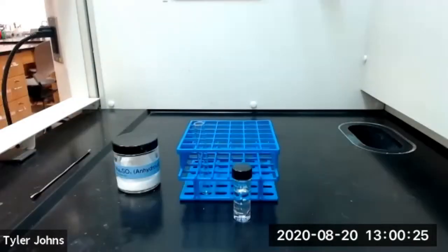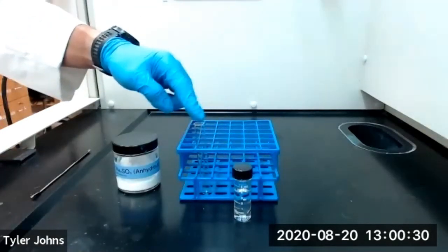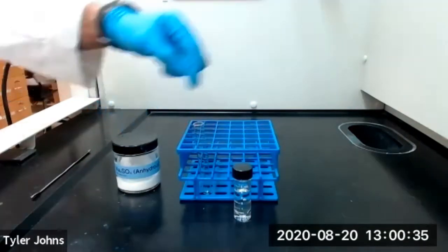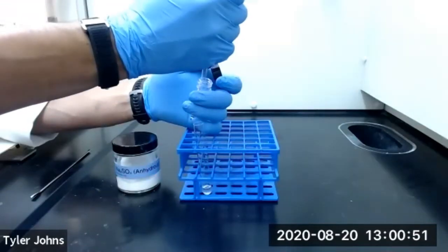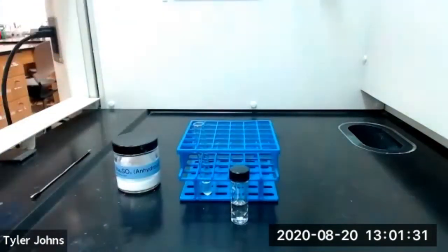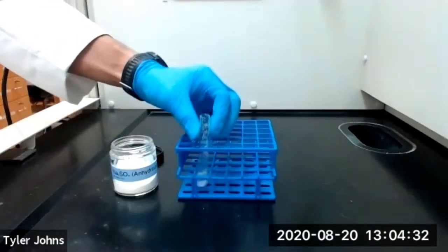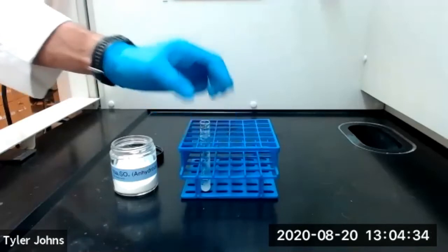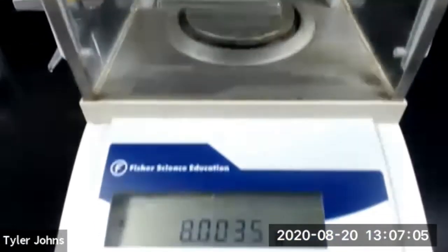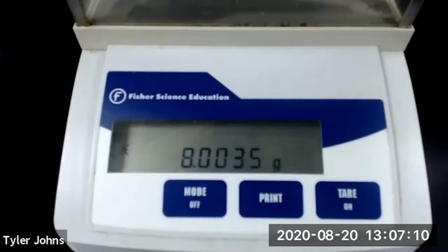We'll now transfer the bottom organic layer of methylene chloride to a new clean test tube and dry the organic layer with anhydrous sodium sulfate. As we wait for the organic layer to dry, we need to pre-weigh a test tube. The mass for our pre-weighed test tube is 8.0035 grams.